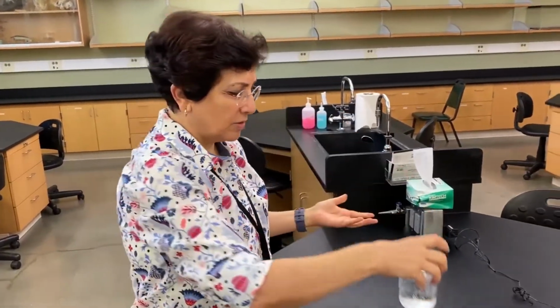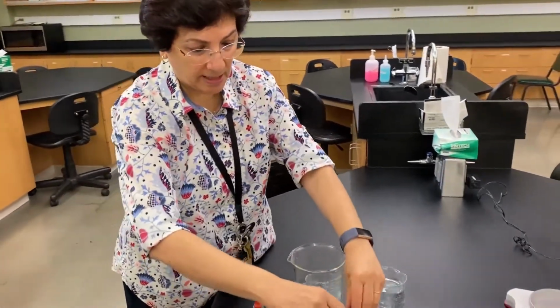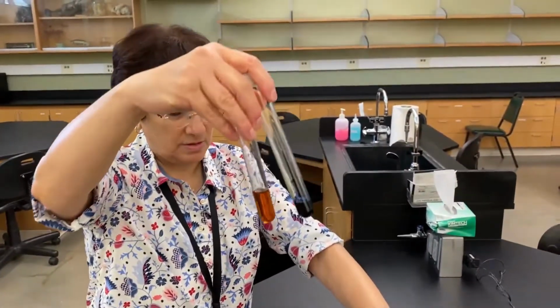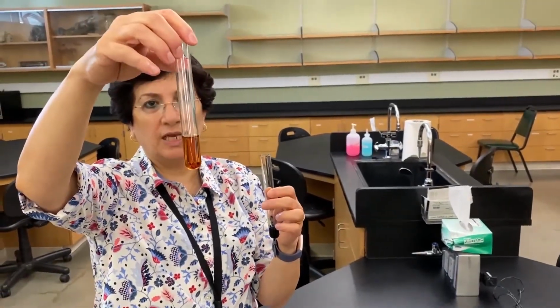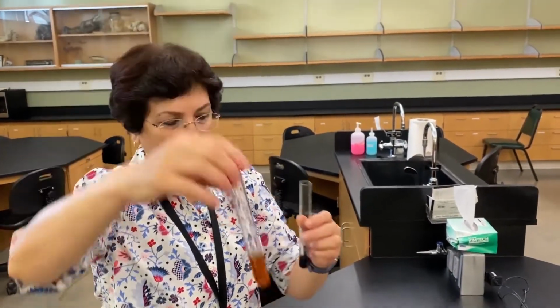Again, what is the conclusion? What are the results of this experiment? So if you compare, again, we have the tubes for you, inside and outside. So, sorry, let me put this down. This is outside. We tested for starch and it tested negative. So starch did not leave the dialysis tube.